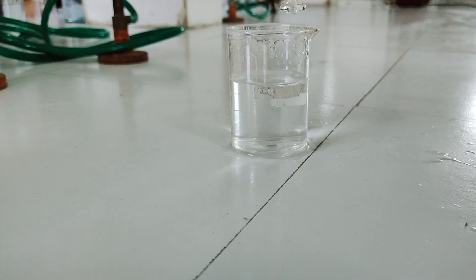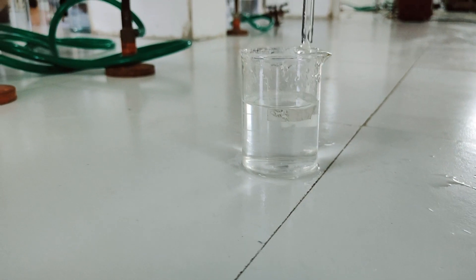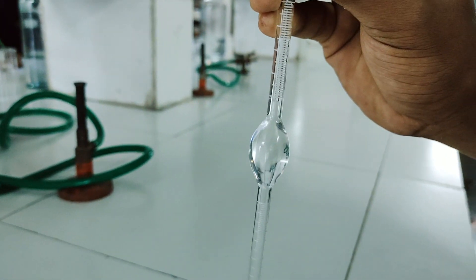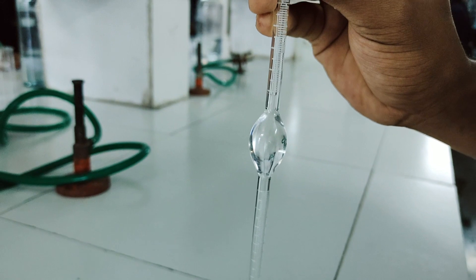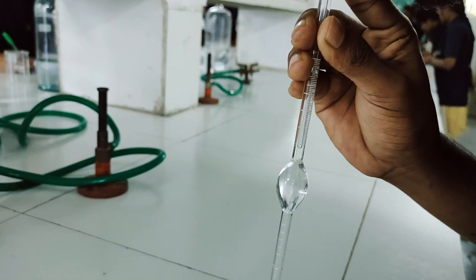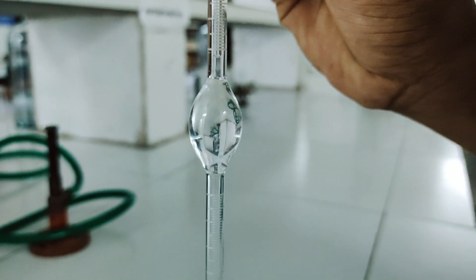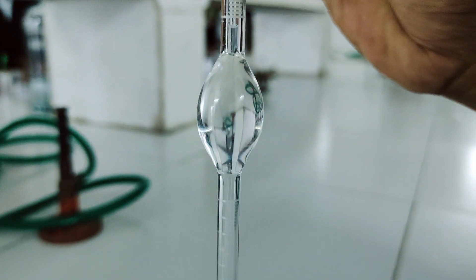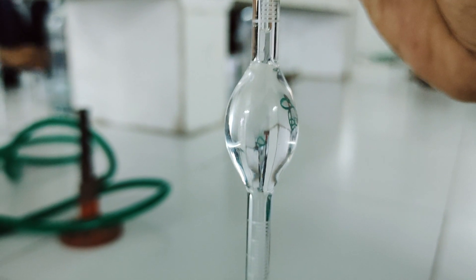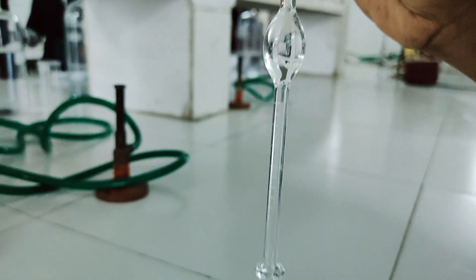This is how you can determine the surface tension of the unknown liquid using a stalagmometer. This is the liquid whose surface tension is to be determined. Suck the liquid up — after sucking, you can see it is exactly at mark A.